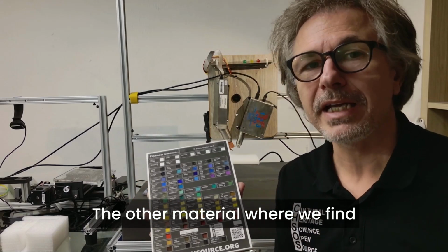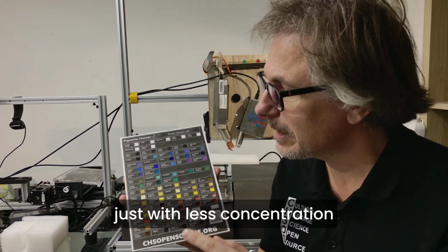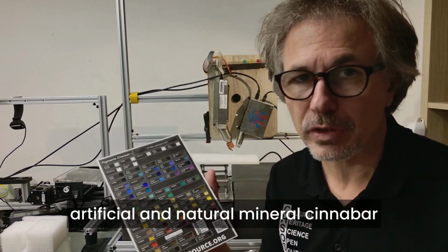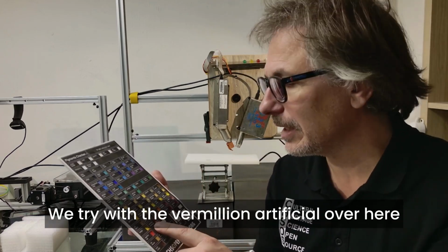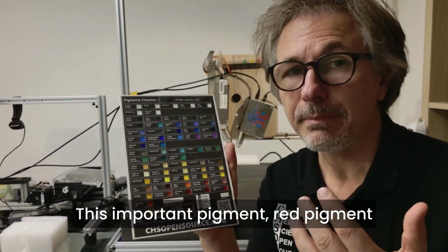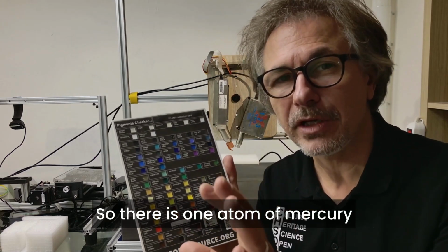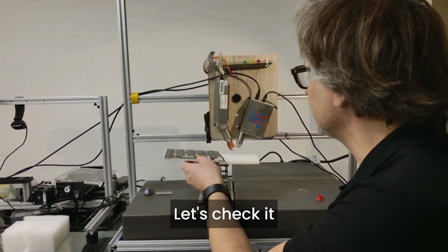The other material where we find sulfur, just with less concentration, is vermilion, the pigment over here. We have both the artificial and the natural mineral, cinnabar. We try with the artificial vermilion over here. Vermilion, this is an important red pigment, is a mercury sulfide. So there is one atom of mercury and one atom of sulfur. Let's check it.